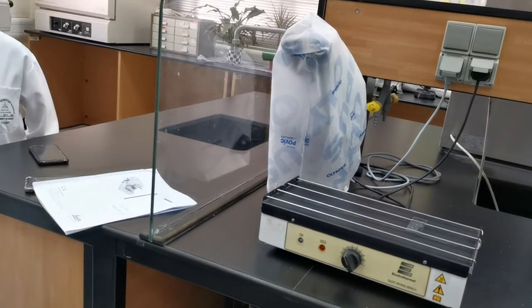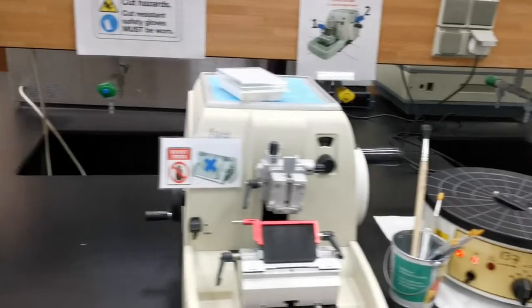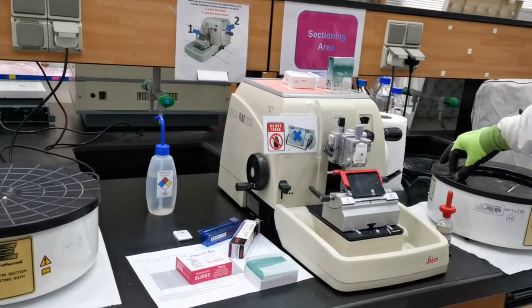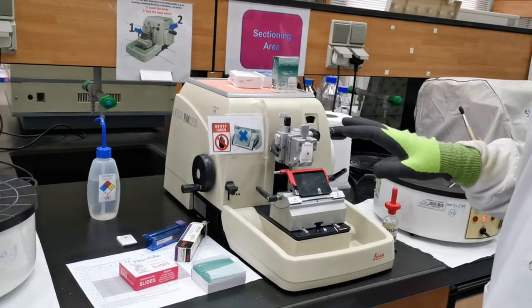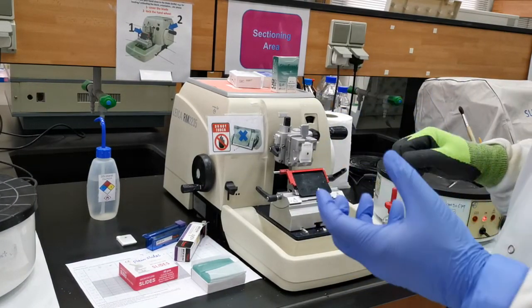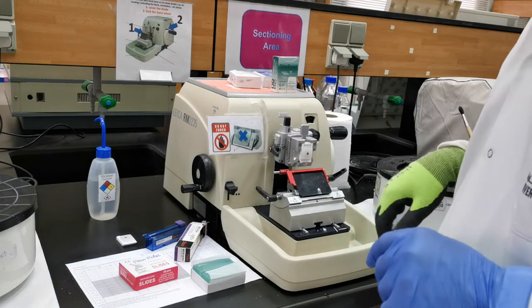So both drying methods are doable. This is all about getting the sections and doing the cutting. It's more of a technical skill, so all you need is to practice — it's all about practicing. It's all yours, and thank you.